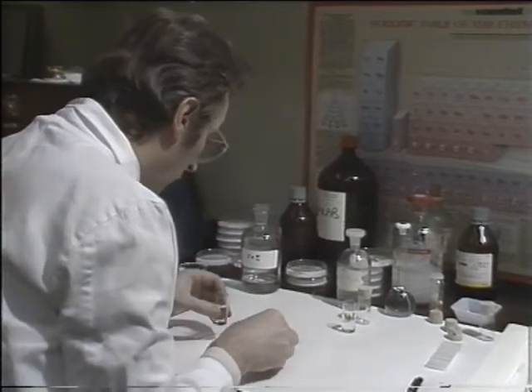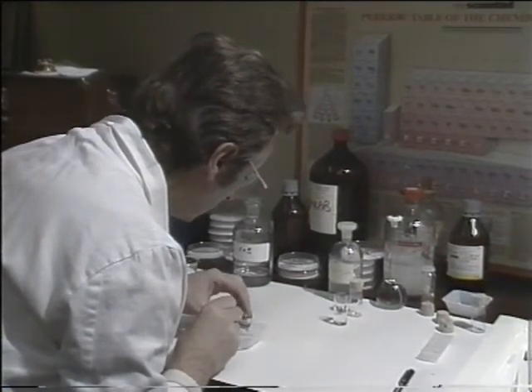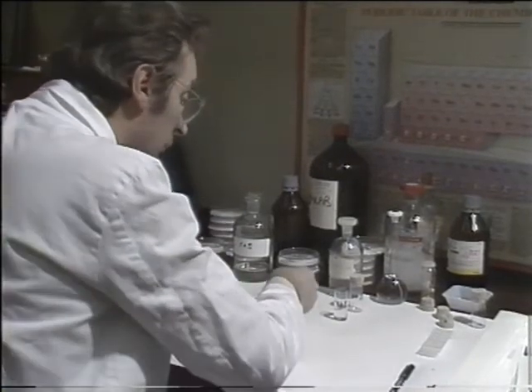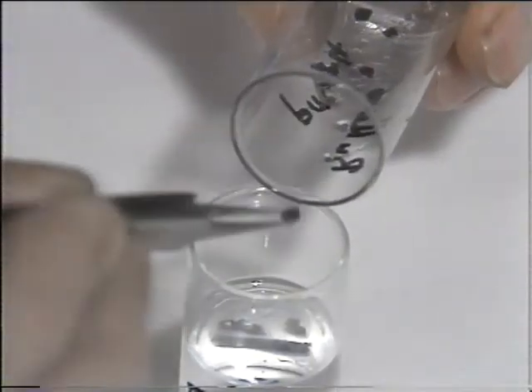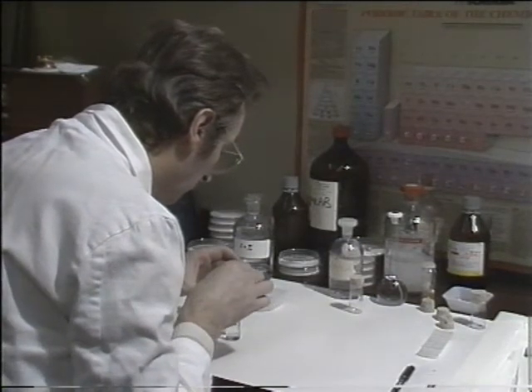If the specimen is too large to be studied whole, it must be sliced into thin sections. First, though, the structure of the specimen is stabilized by treatment with chemicals, glutaraldehyde and osmium tetroxide, so that as much detail as possible is preserved when the specimen is cut into sections.